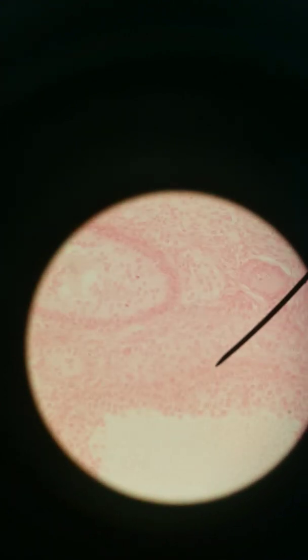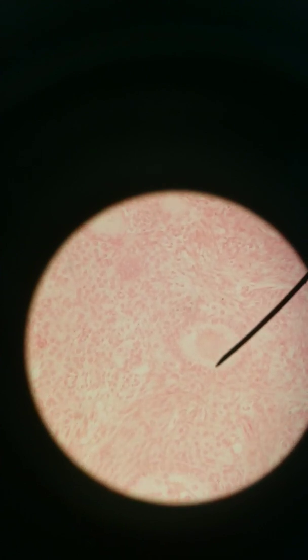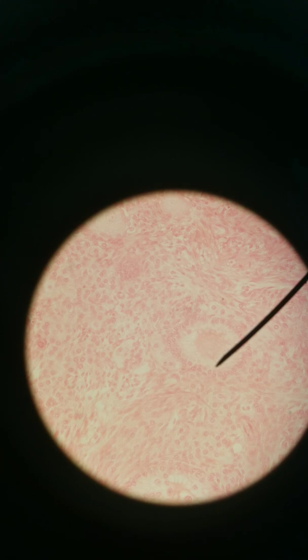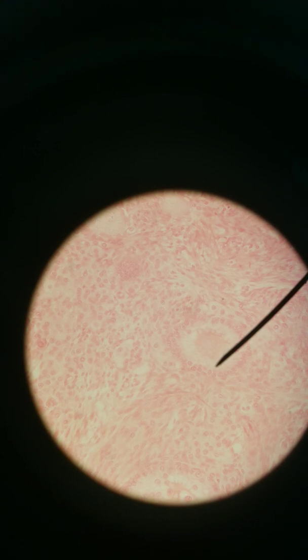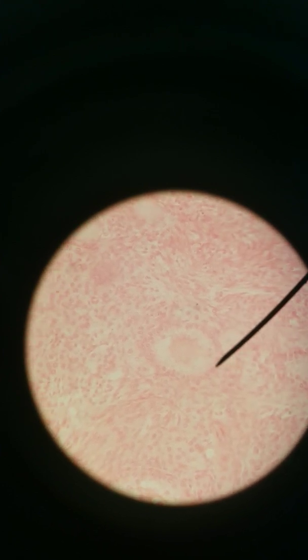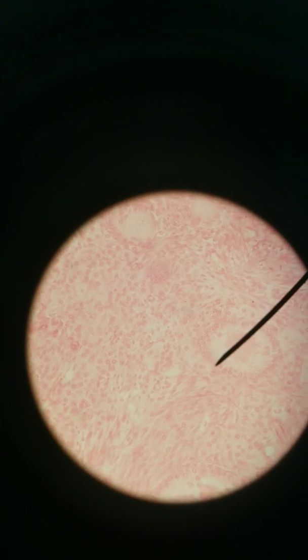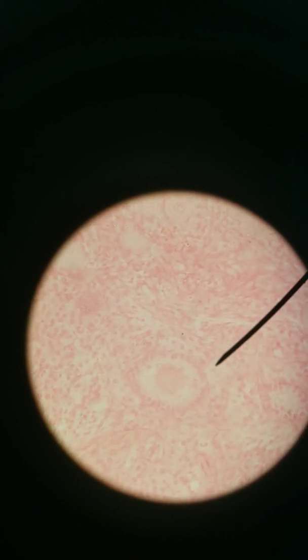Let's find a follicle that's a little farther along. Here we can see the oocyte from here to here. Oocytes are the largest human cells by volume; sperm cells are the smallest human cells by volume. There are of course longer ones like neurons and muscles. The oocyte is in the center, and we have granulosa cells surrounding it — you can see these dark round nuclei. Those are granulosa cells; they're the ones that will be producing estradiol, the major form of estrogen. This is a primary follicle, so theca cells haven't fully developed yet around the outside.